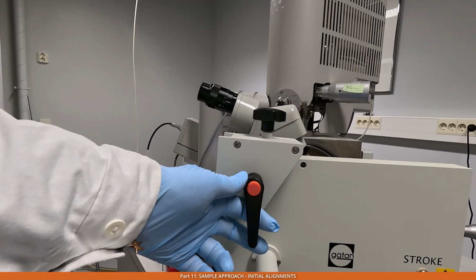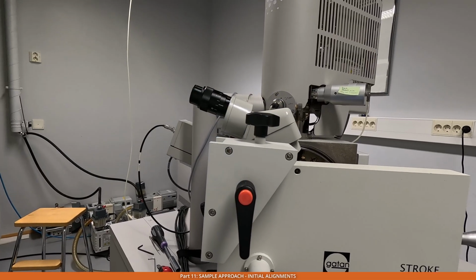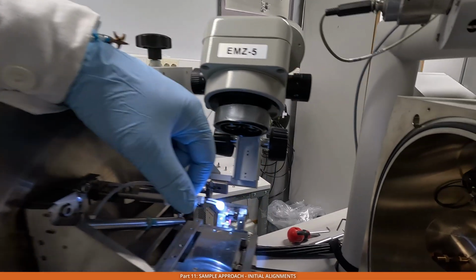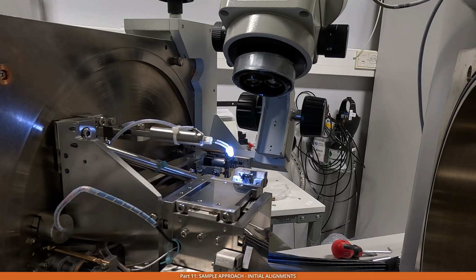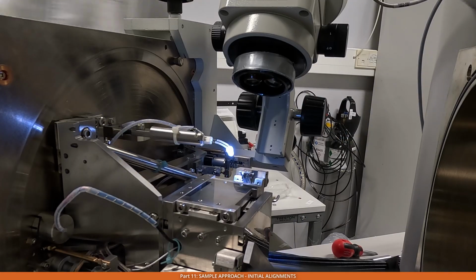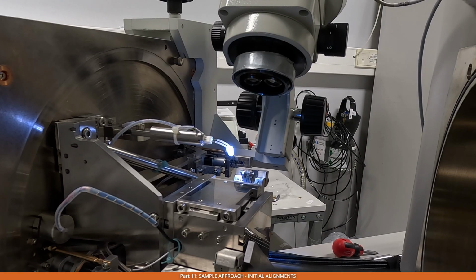Now use this bracket to keep the stereo microscope, which can be adjusted if needed. This lower one tightens it so it sits firmly on the door, and this one can be used to lift it up and down. To start with, we need to make sure that our diamond knife is above the sample. To do that, we can do the following operation. I can take a hex wrench, place it in here, and then I can go to the computer and press microtome.